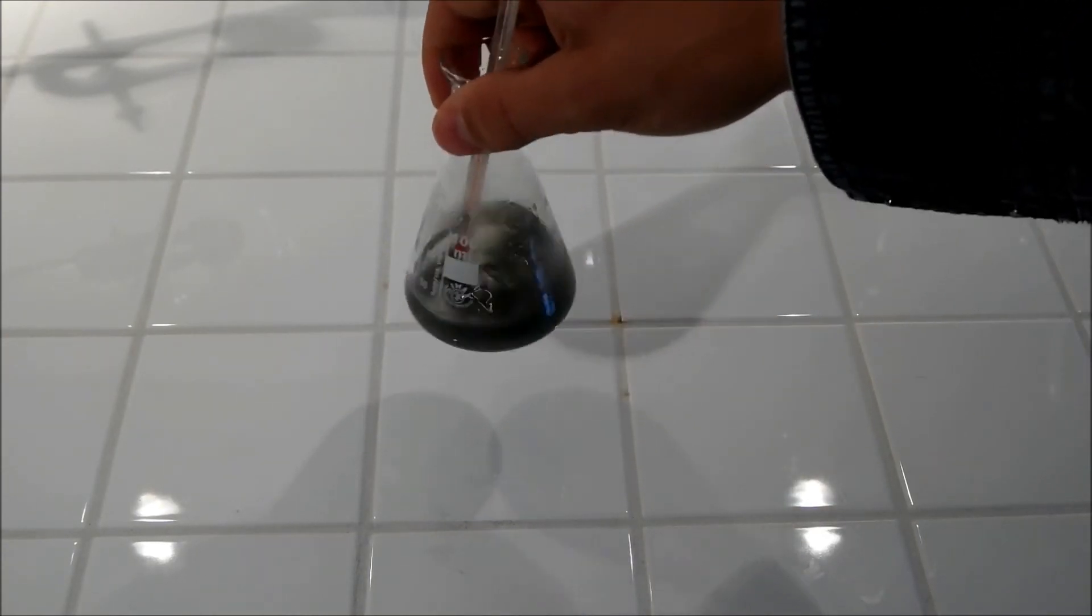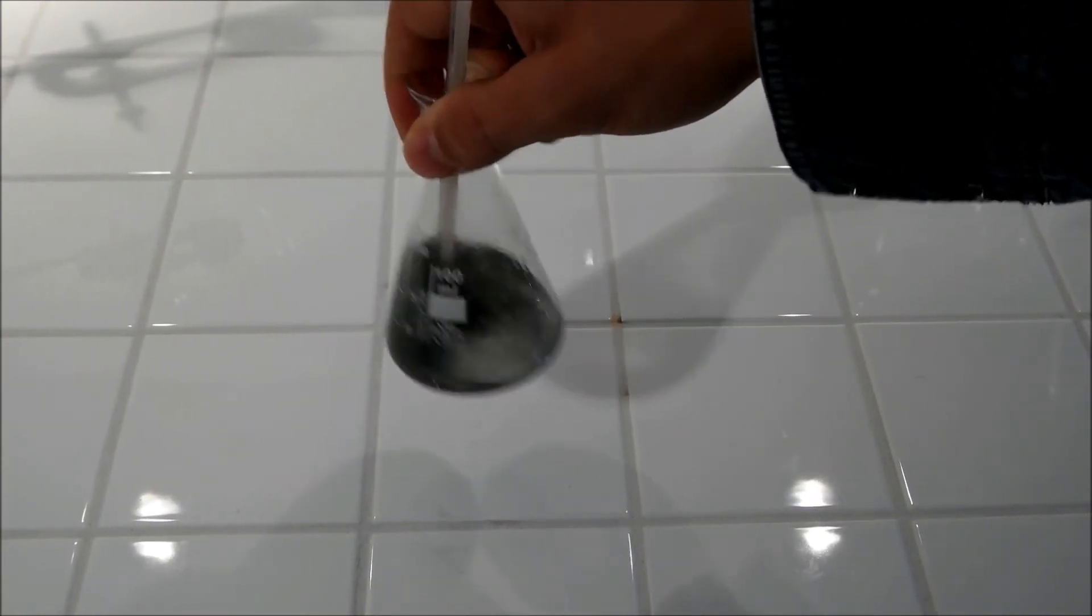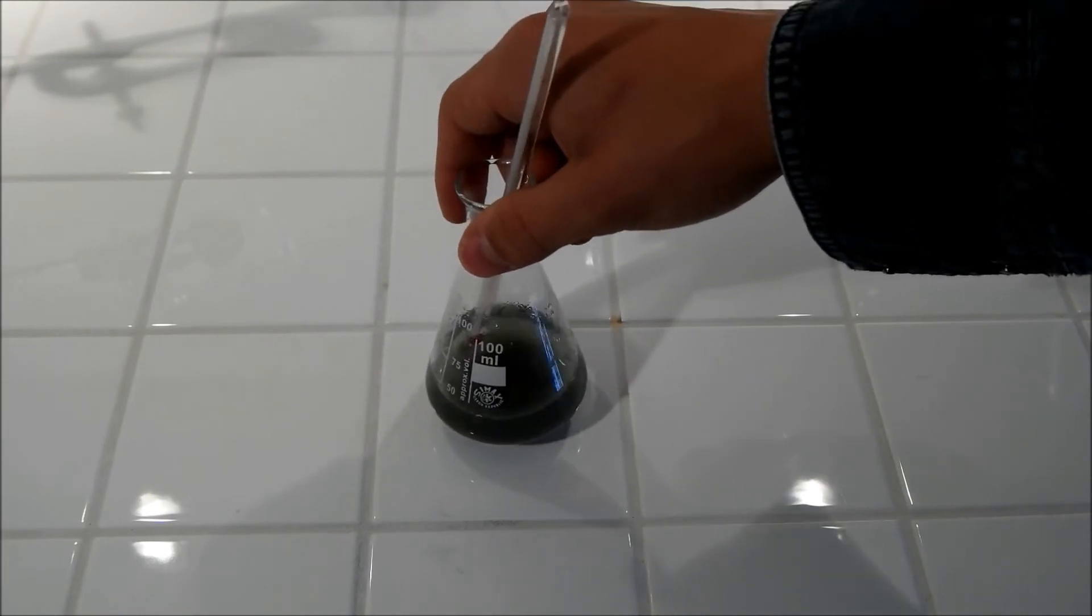So what we got here is a zinc iodide solution which we will use for our electrolysis.